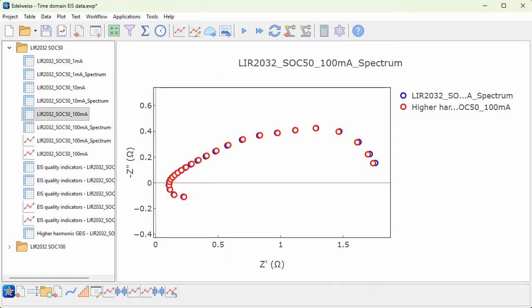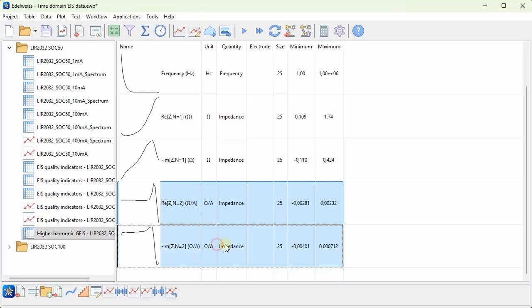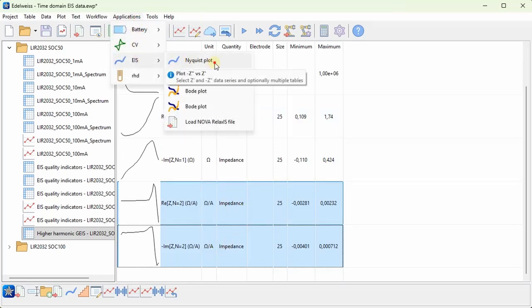It's not completely the same though, which is interesting, so probably the instrument does some kind of correction that slightly changes the impedance values. But what is interesting for us is perhaps to look at the second order spectrum, so I can choose those data series and again plot it as a Nyquist plot.